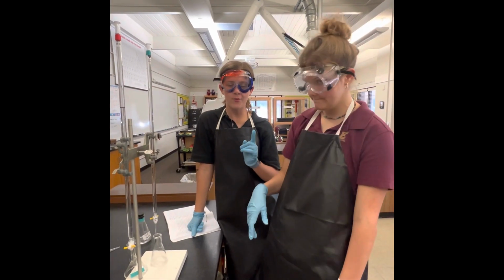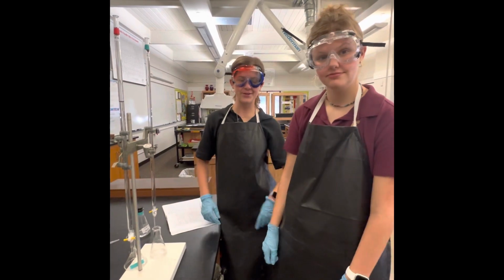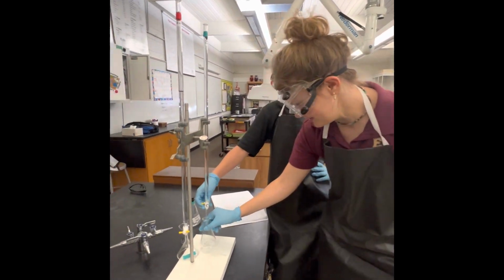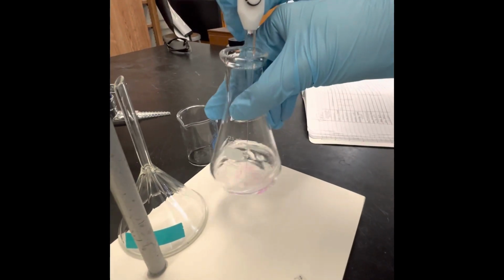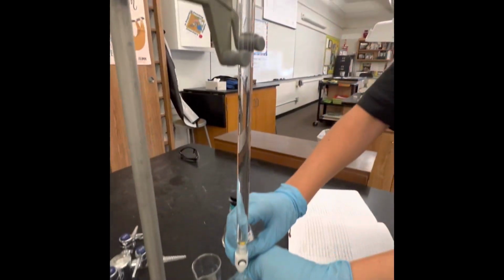The other burette was filled with the standard base solution of sodium hydroxide above the 0.0 milliliter mark. Then some of the base was released to the 0.0 milliliter mark to release air bubbles from the tip. The flask with the acid and the indicator was then placed under the base burette. The base was slowly released into the flask, and the flask was continuously swirled. Now we are adding the base to the acid until it reaches its endpoint. We're swirling it so that the acid mixes in.